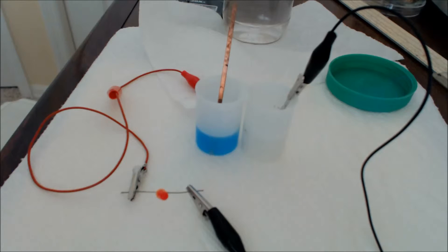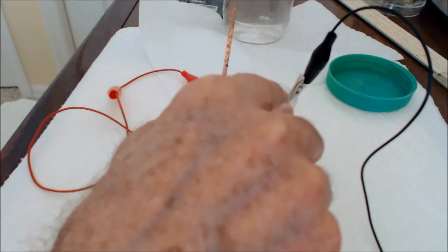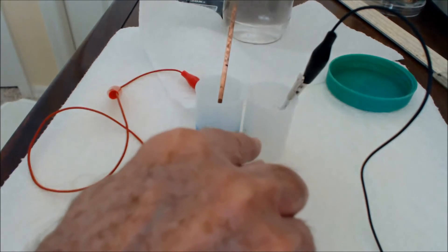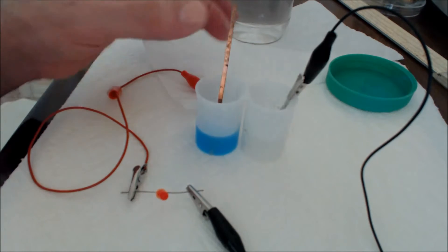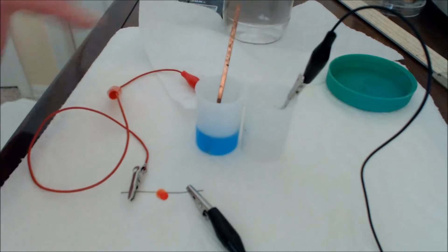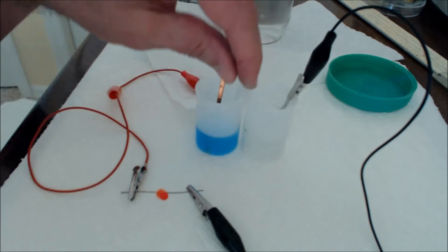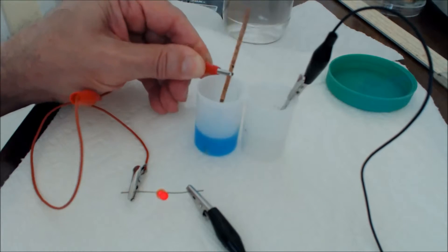And we're going to now make that into an electrochemical cell. So we have here a strip of magnesium ribbon immersed in a solution containing magnesium ions. And we have here a piece of copper metal immersed in a solution of copper sulfate. And we have a salt bridge. It may not be that apparent, but it's there. And so now I'm going to complete the circuit.